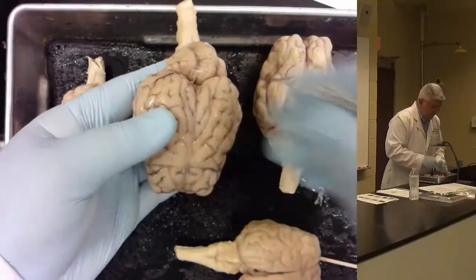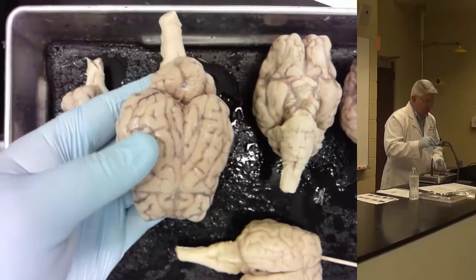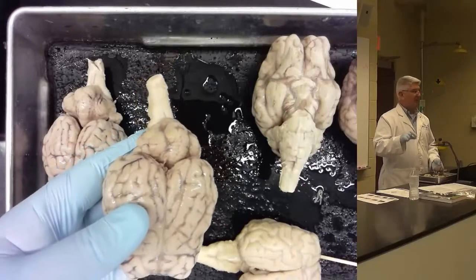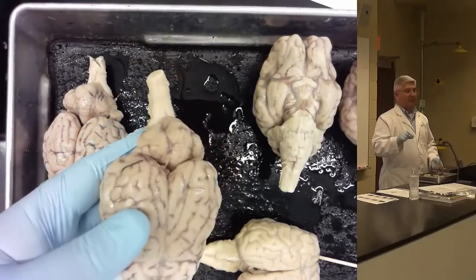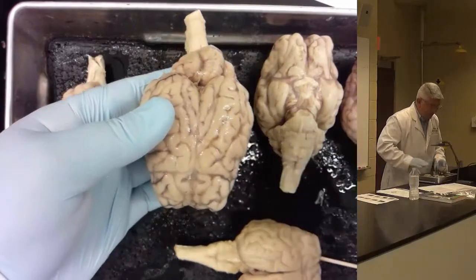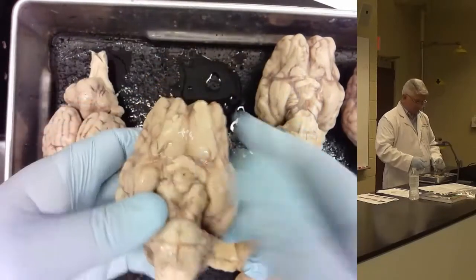Okay? All right. The 10 through 14 of that section, the lobes, I'm only going to mark lobes on human brain plates. I'm not going to mark lobes in the sheep brain because they don't have a very big temporal lobe and the definitions are hard to see. So I'm only going to mark lobes on the human brain. Okay? That's everything on the cerebral cortex on the top part. So we're going to flip over to the bottom part. Okay?